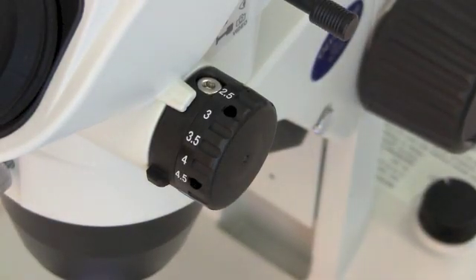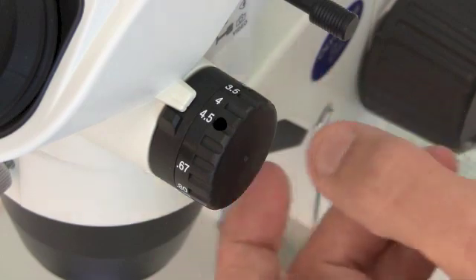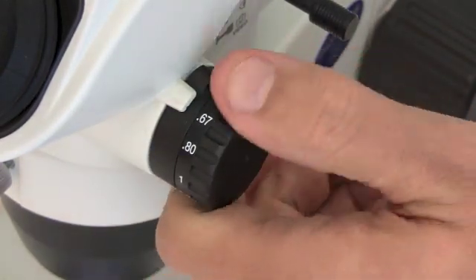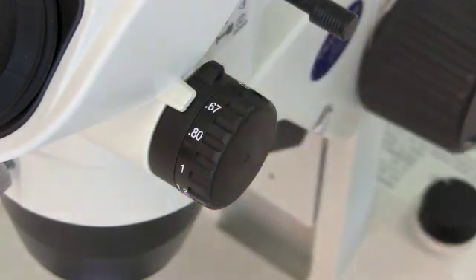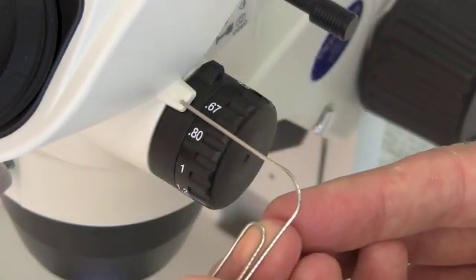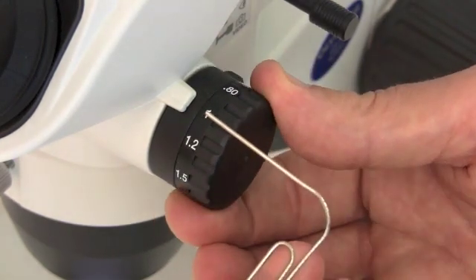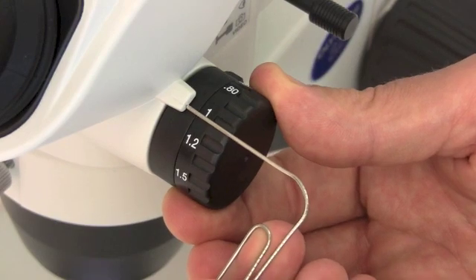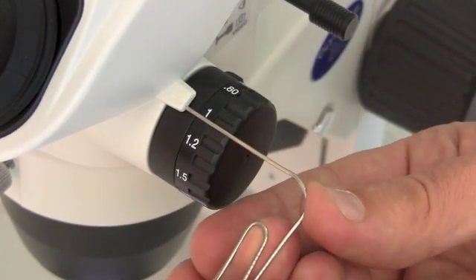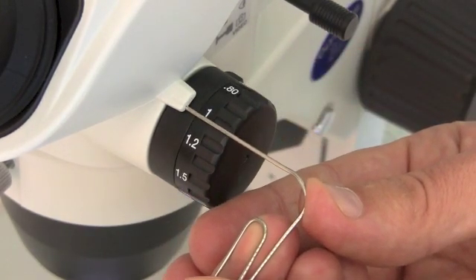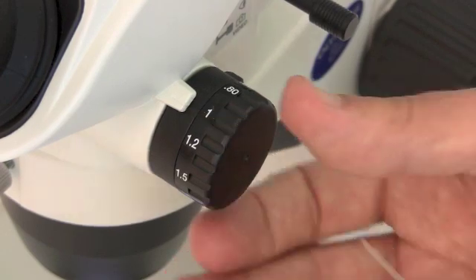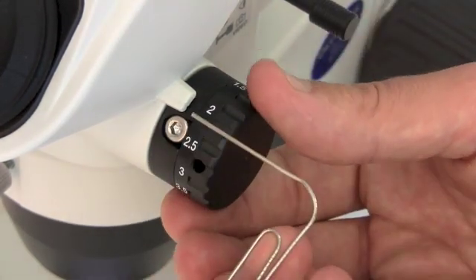Now what we're looking at, and it will be very important later on, is the magnification knob. You can see this goes all the way up to 4.5 times magnification and all the way down to 0.67. It's important to get this in the right spot. You can see a line here on this white outcropping, and that line indicates that it's now at magnification of 1 times. The number has to be just above the line. So if we go to 2 times, that's now at 2 times.